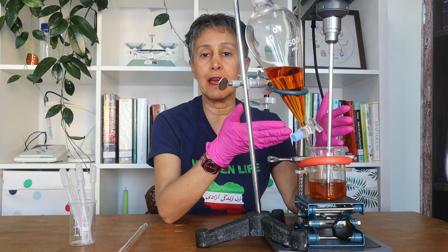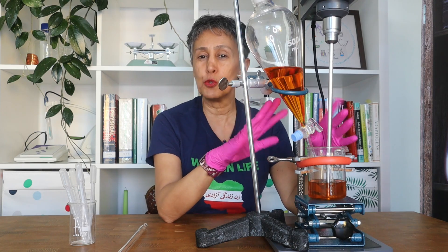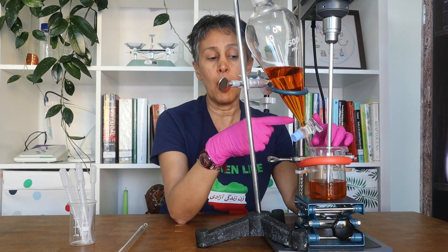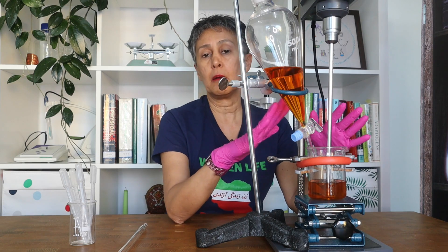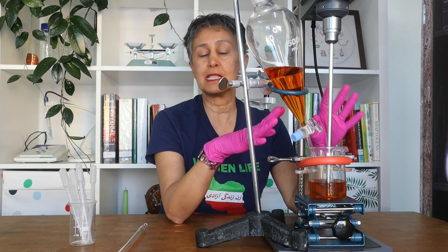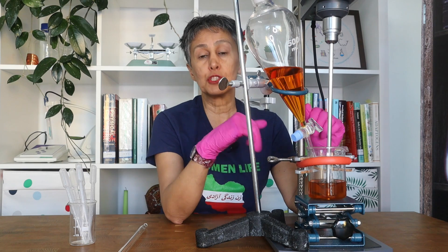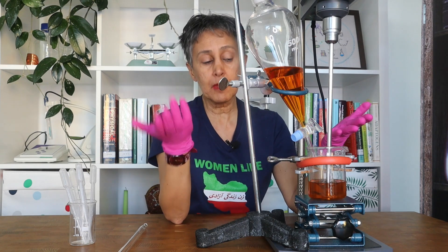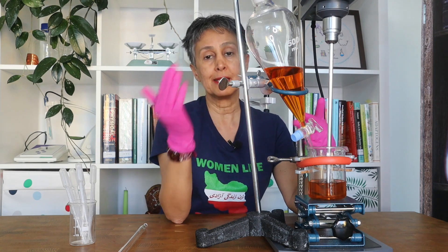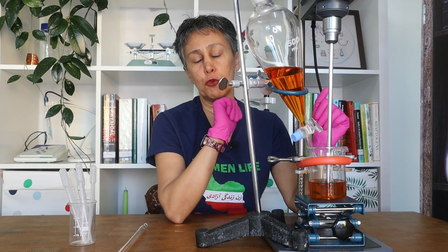But you don't need to stay there and be on top of it the whole time. You can come and have a look and adjust the speed every now and then, but otherwise it works perfectly on its own. It will spare you time and much muscle power, and give you time to attend to other projects and then come back and collect the final formulation.